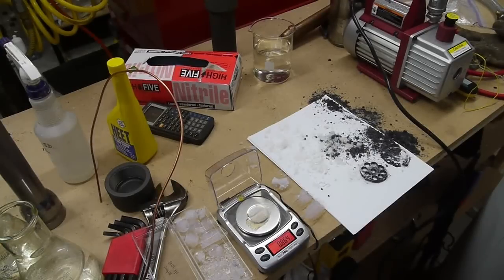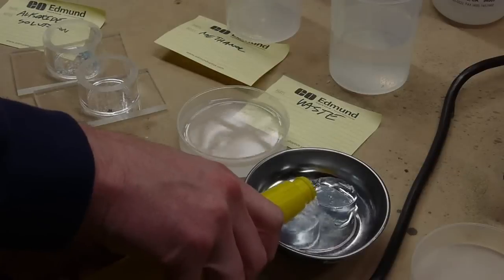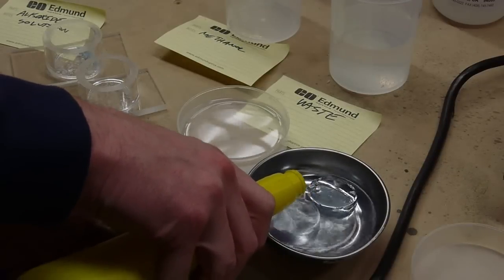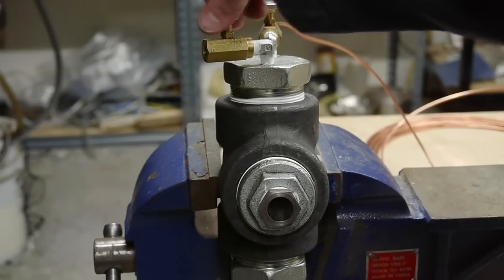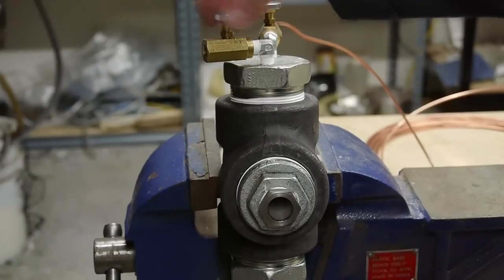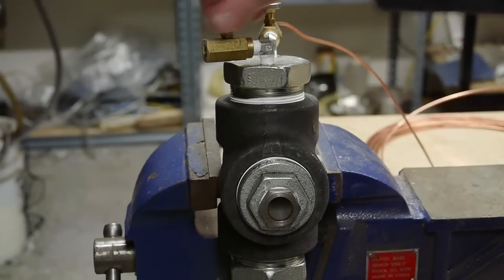Hey everyone, I'm going to show you another method to dry aerogel. In my previous videos I showed a methanol bath and then an exchange into liquid CO2, and then CO2 into supercritical CO2 where we can remove it without destroying the aerogel structure.